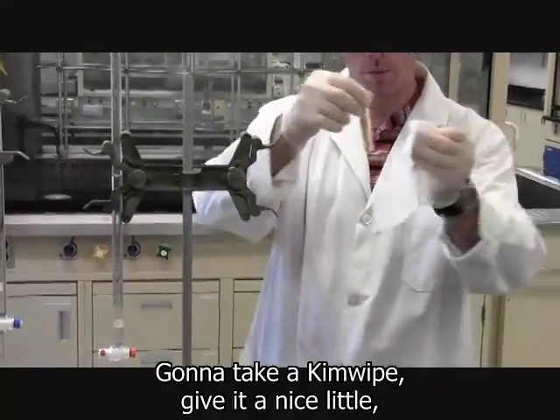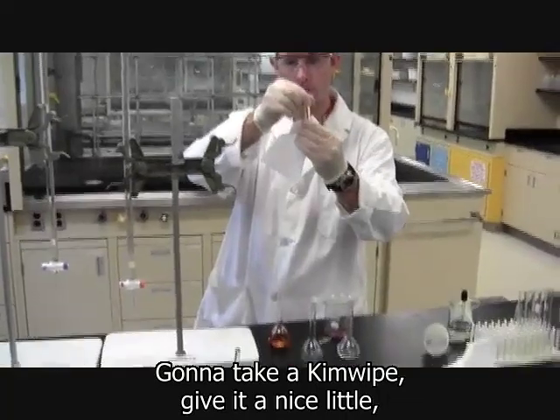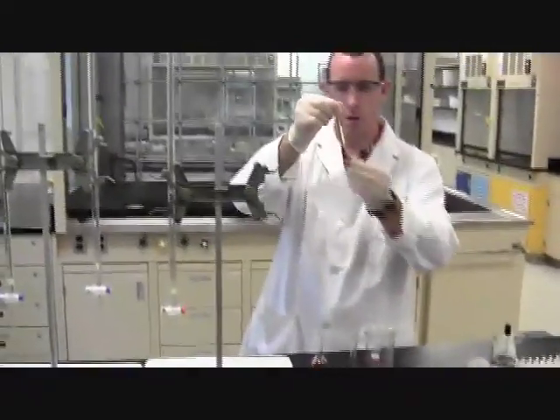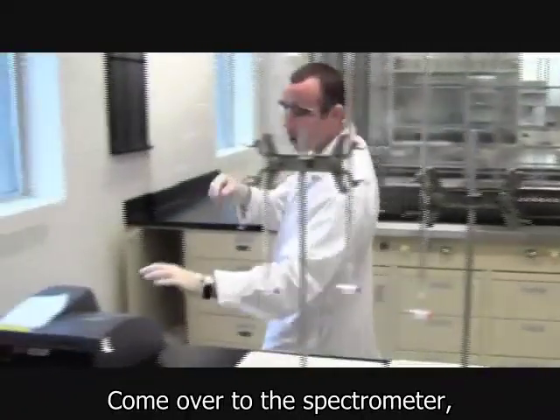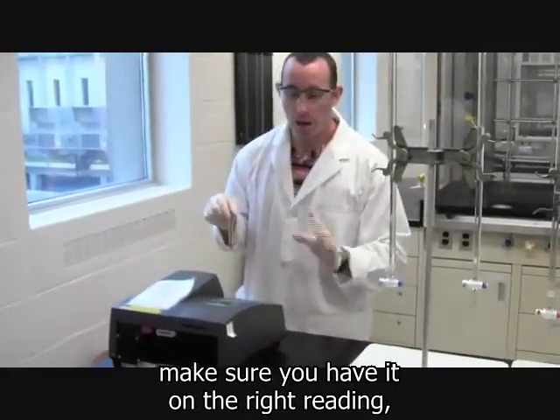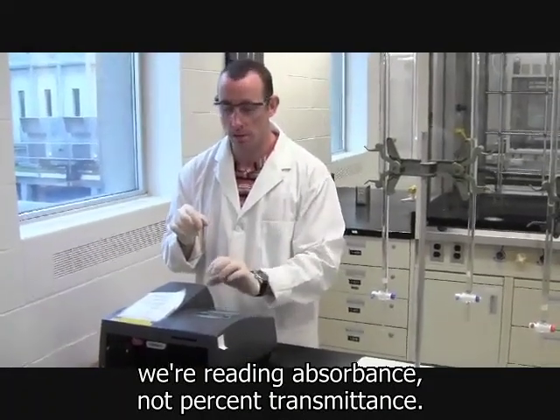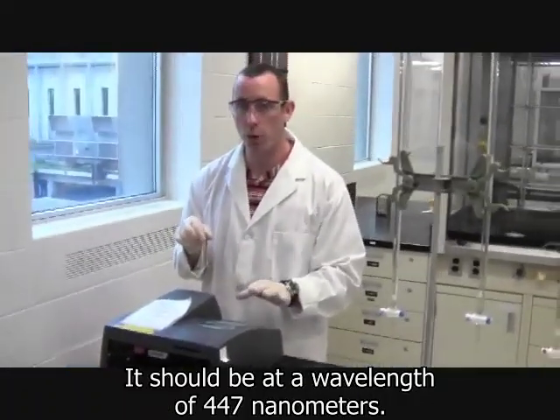I'm going to take a Kimwipe and give it a nice little gentle wipe down. Come over to the spectrometer. The spectrometer should be on. Make sure you have it on the right reading. We're reading absorbance, not percent transmittance. It should be at a wavelength of 447 nanometers.